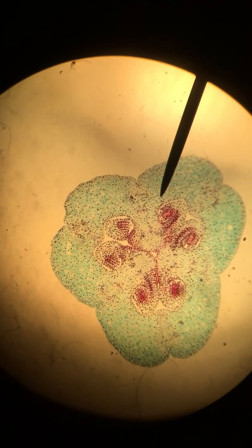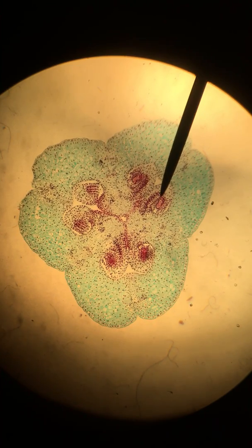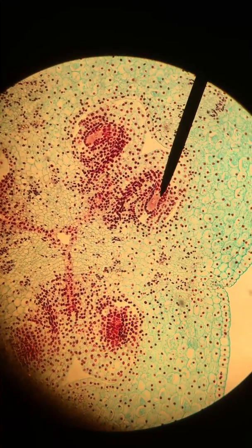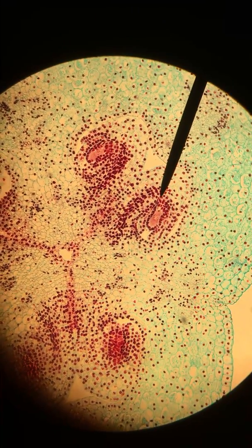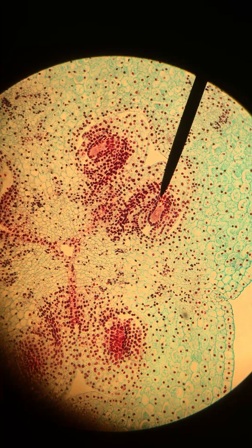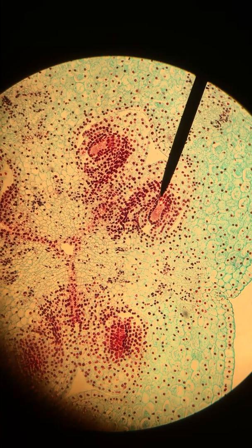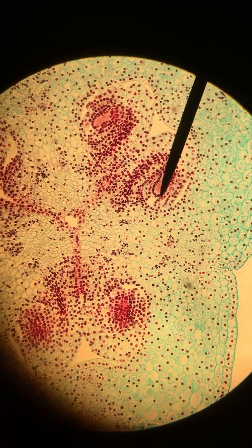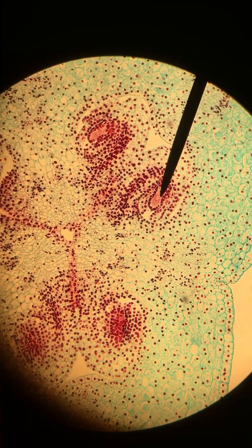Now we are going to take a closer look inside one of our ovules. I am going to increase our magnification to about 100x so that we can see those a little bit clearer. This is one of the ovules, and we will take a look inside. The ovules house our megasporangium, which is this space here — it is the sac which will hold our megasporocyte, which is this very large cell.